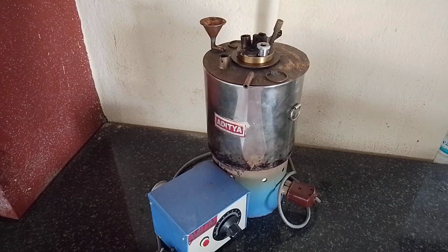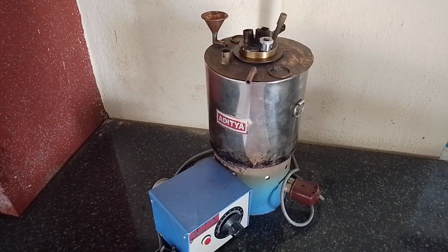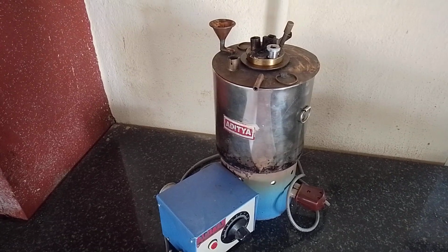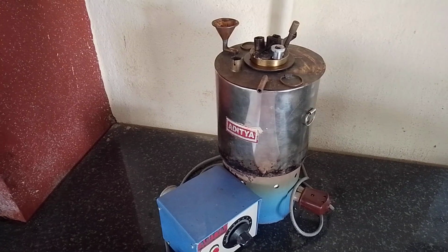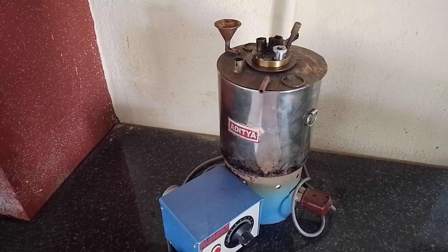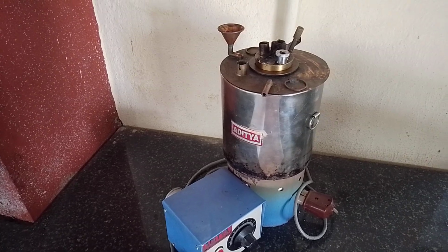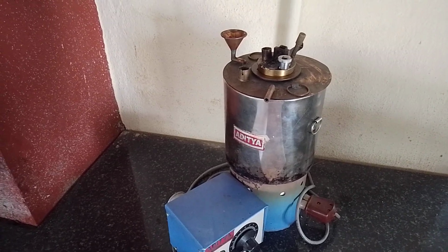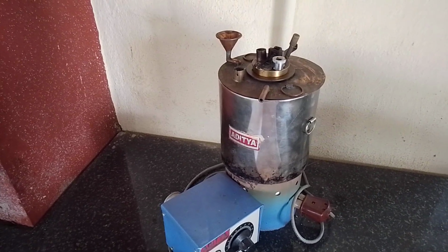A fractional amount of vapor will be given off and it is negligible, but as the temperature is continuously increased, the rate of release of vapor also rapidly increases. The flash and fire point tests are conducted to predict the temperature and also to indicate where sufficient vaporization may take place to change the condition of the oil.